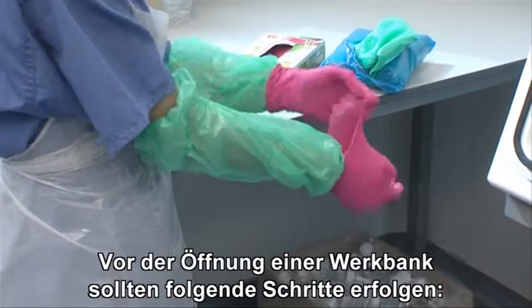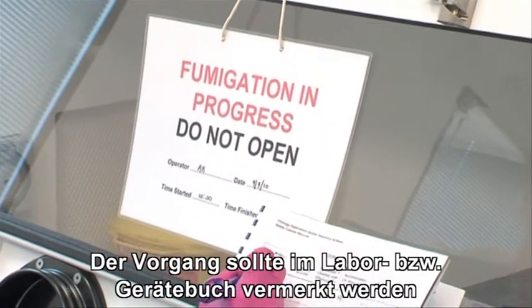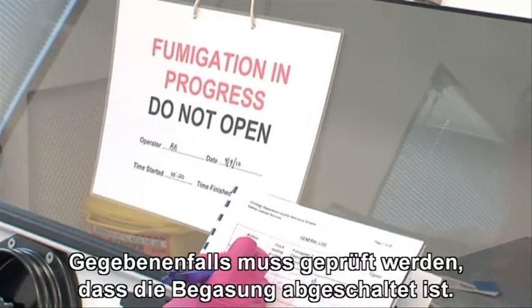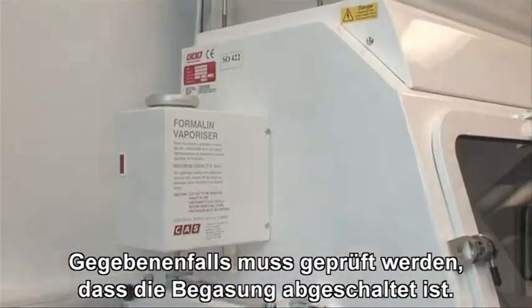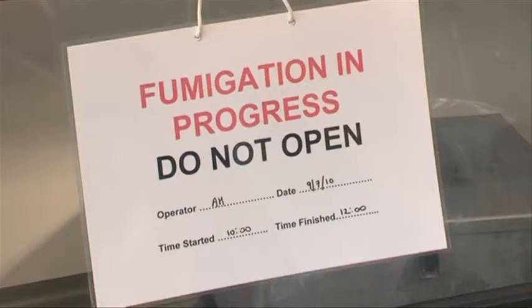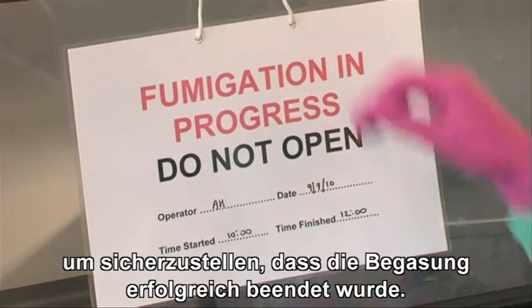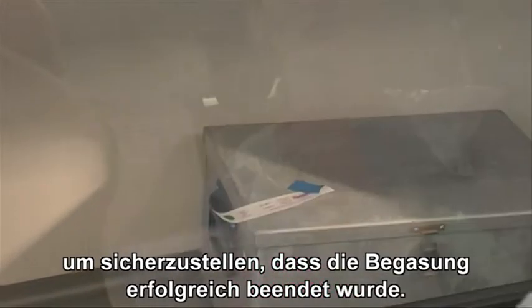When opening up a cabinet, there are a number of checks to go through. The logbook should be checked and filled in. Where appropriate, staff must check the fumigation unit is turned off. The fumigation indicator must be checked to make sure the fumigation cycle was successful.